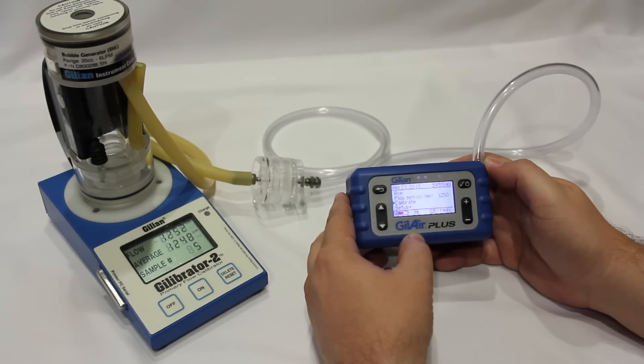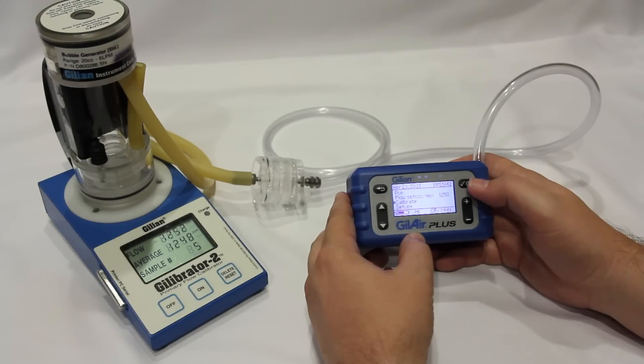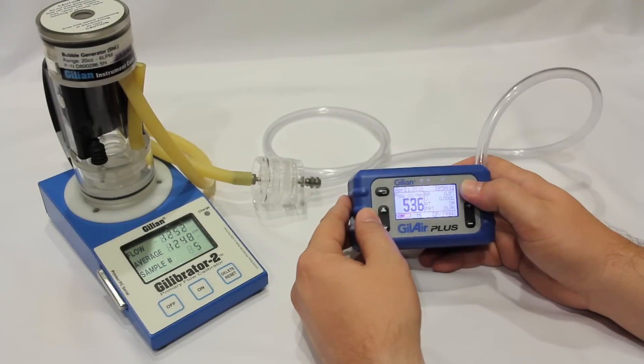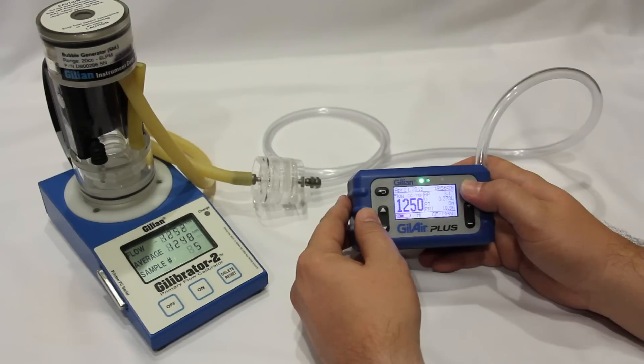You're now ready to begin sampling. Scroll to run and press enter to begin your sample.